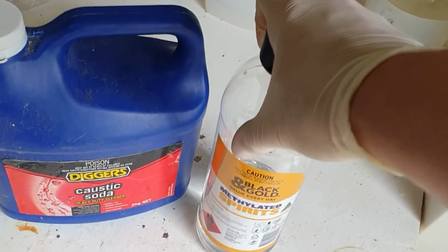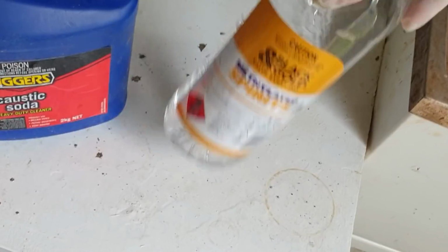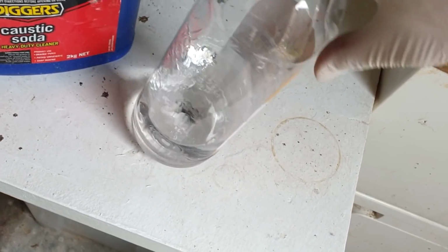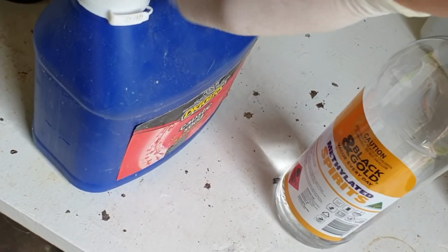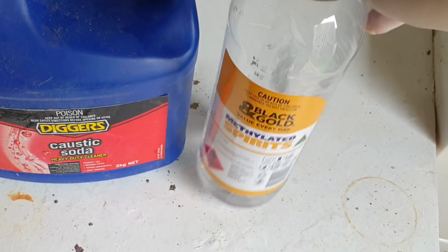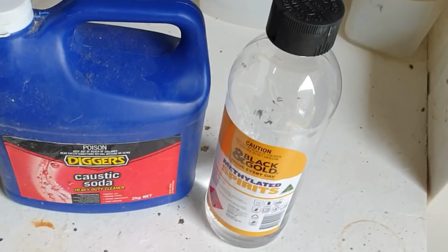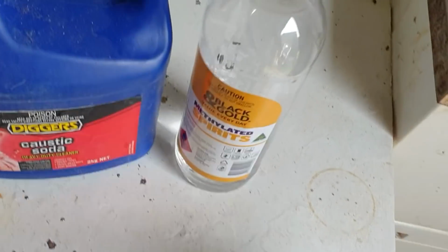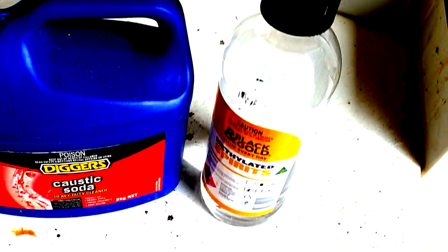We're going back to our roots here with hardware store ingredients. It's just ethanol from the hardware store. It's 95% ethanol with some denaturants in it. It's called methylated spirits. Doesn't actually have any methanol in it. Sodium hydroxide, this big container of sodium hydroxide. And we're just going to use both of these without further purification, just straight from the hardware store shelf. So yeah, back to fast and loose. Not worrying about drying anything out or redistilling stuff. It's just fast and loose, and we'll see how we go.